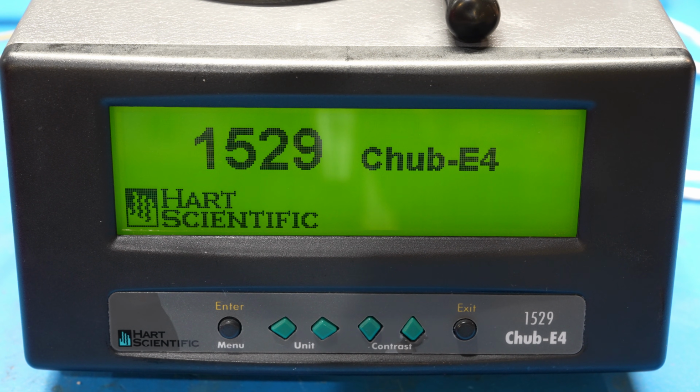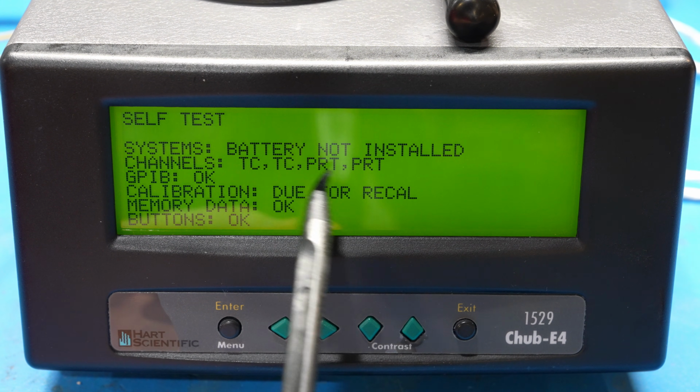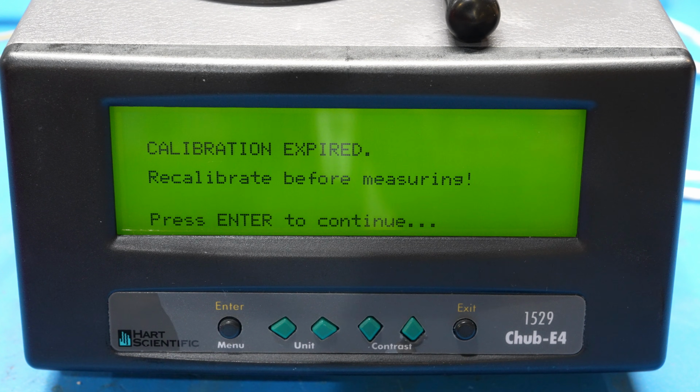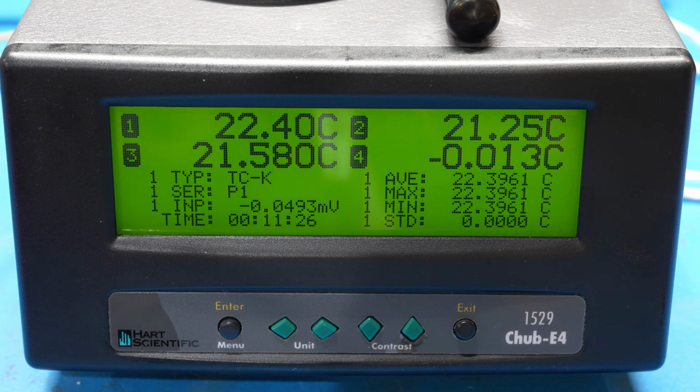It should say that we have 2 different kinds of channels. And look at that, TC, TC, PRT, and PRT. So it does detect that. So the firmware is indeed common for all of this. Yeah, calibration expired. We know that. Let's see if it brings up all of our 4 measurements simultaneously. I've put it in all 4 menus. And here we go. Look at that.